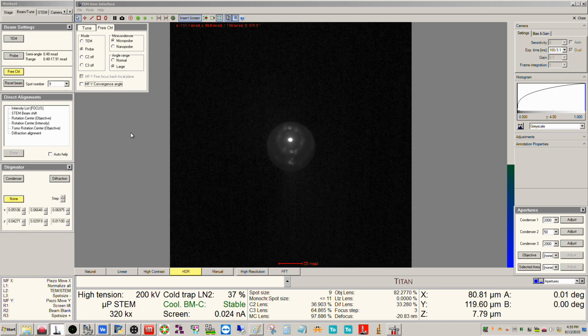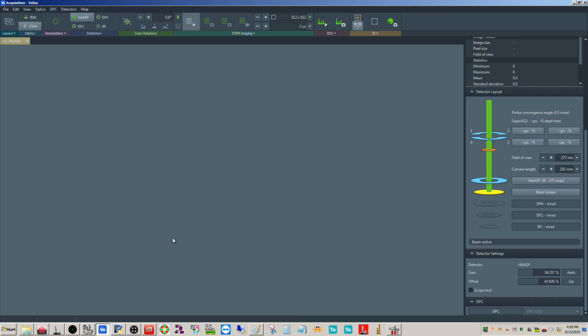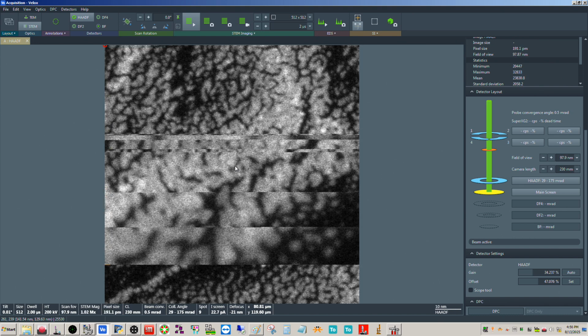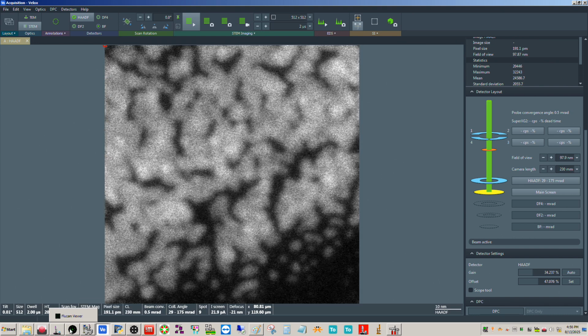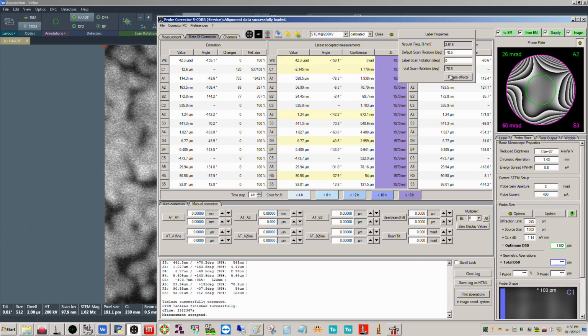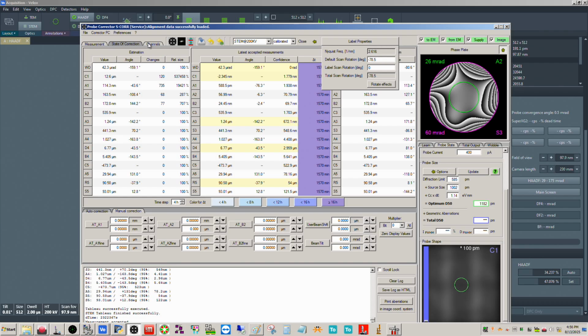But what I'm going to show you today is we're going to use STEM microprobe mode with the smallest semi-angle of convergence. Through the miracle of television, I already have the sample at the right height and the probe already focused on it, so we're good to go. Very briefly, I'll turn on the HAADF detector, so you can see everything looks good. Our semi-angle of convergence is really small right now, so your resolution is not going to be very good in this situation.